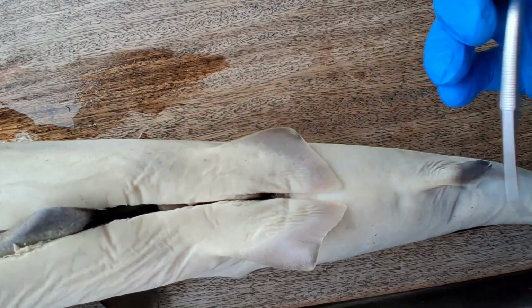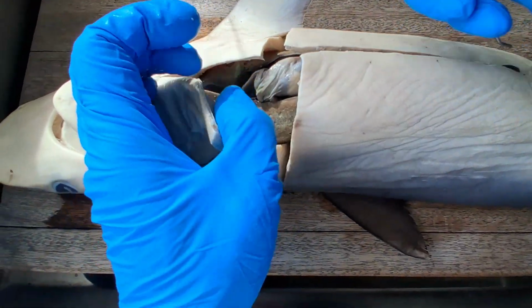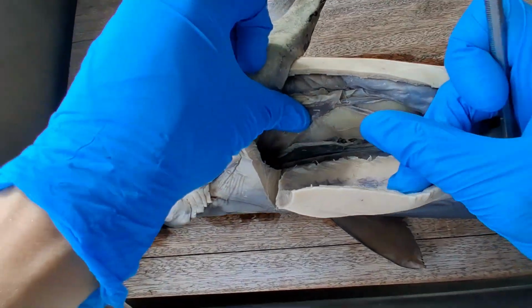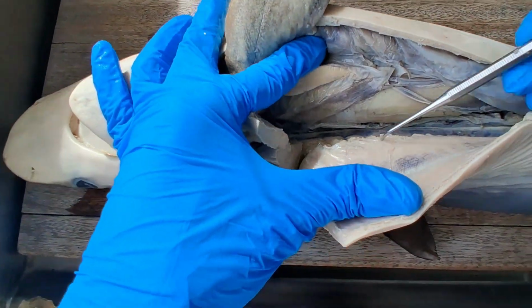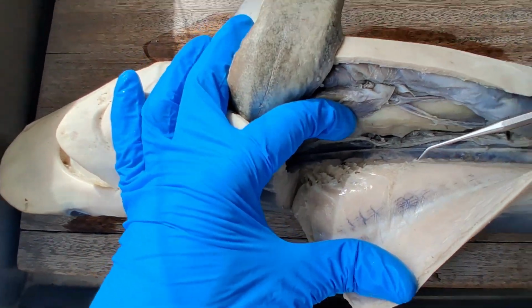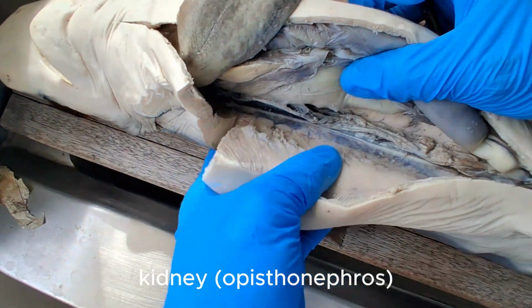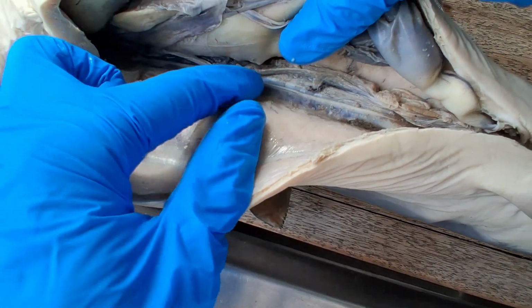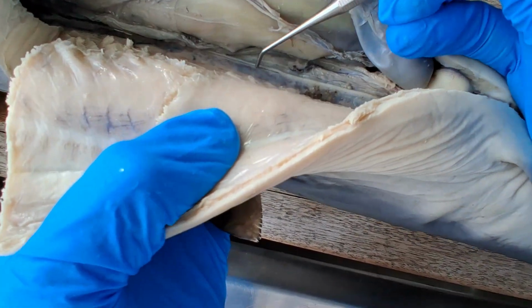So this is a female shark. Take a look at its pelvic appendage. There's no clasper. You can also verify it by looking at what type of gonads it has. So on the back side, you'll see the kidneys. That dark mass on the back side, retroperitoneally located, is the opisthonephric kidney of the shark.